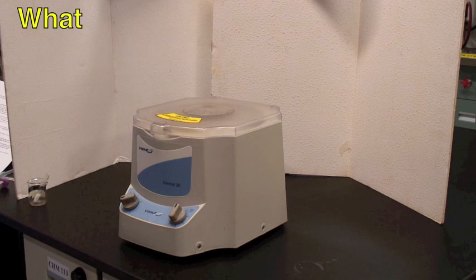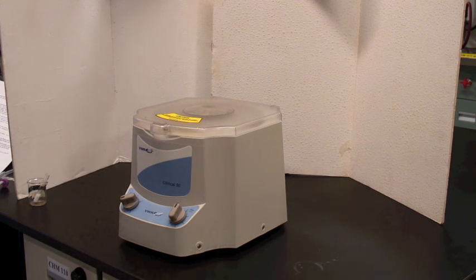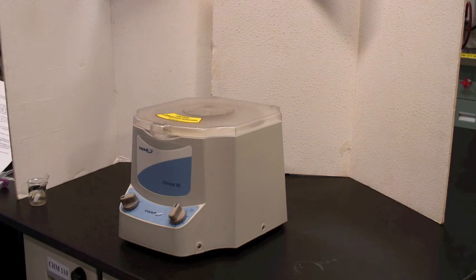A centrifuge is a machine that spins samples very quickly. It causes solids to settle out of suspension in liquids, and this video is to show you how to use a centrifuge.